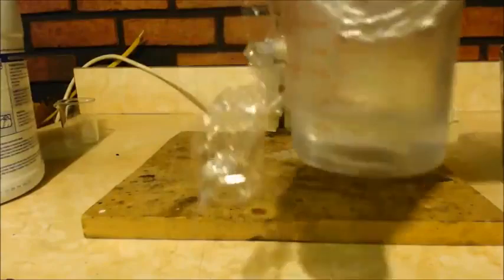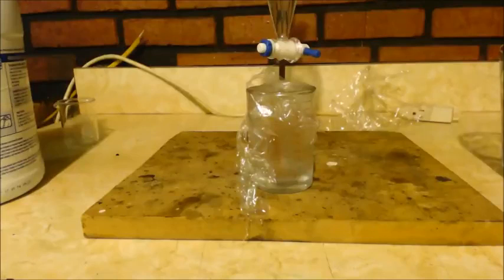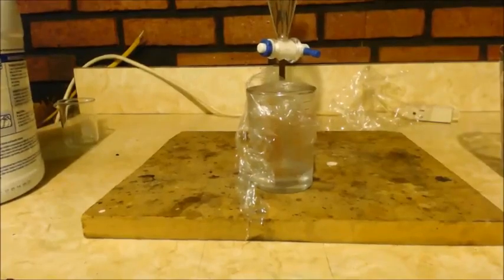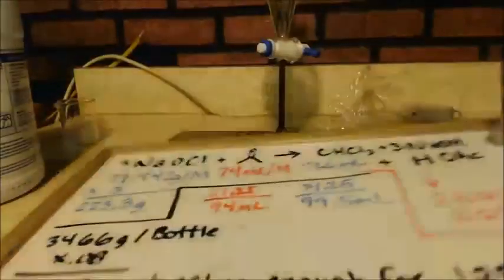Oh, that was terrible. I only got about 20 milliliters there, and it's got water in it, so you figure it's probably only like really 15. But at the 20 milliliter, what's that, like 20% or something? I mean, so I'm gonna do it again, just to show you that I'm just an old man. I just can't see. You know what I mean? This time we'll do it different.